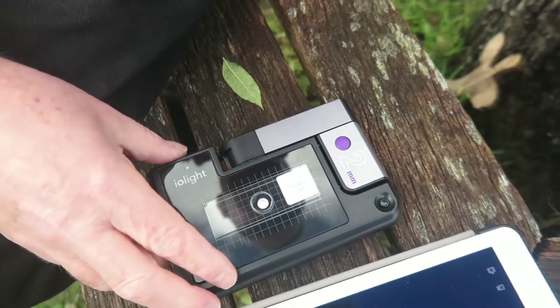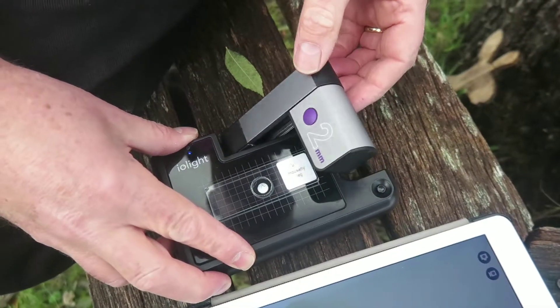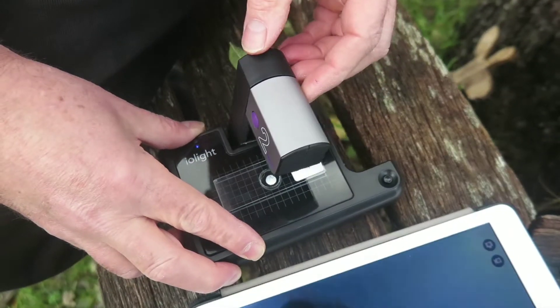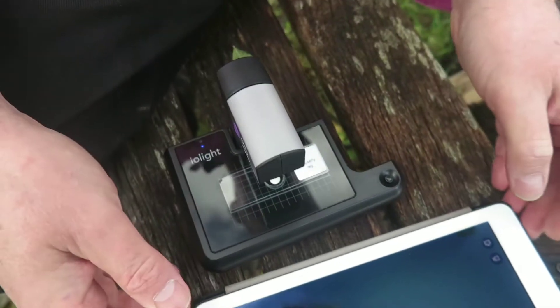We then just simply unfold the mast just by hand like this and immediately you can see on the screen we have an image. It's not in focus but it is an image.